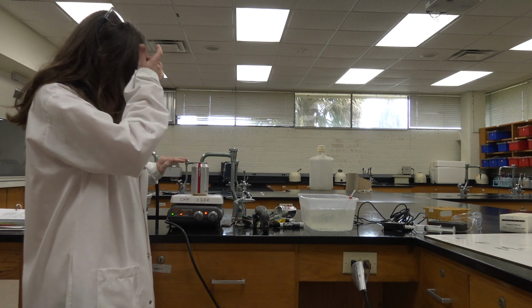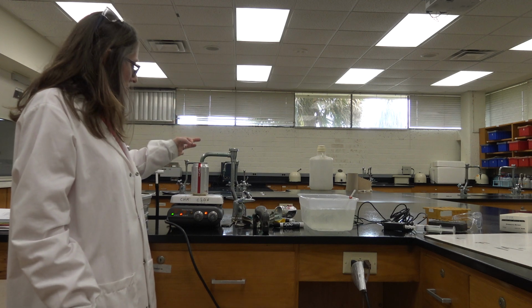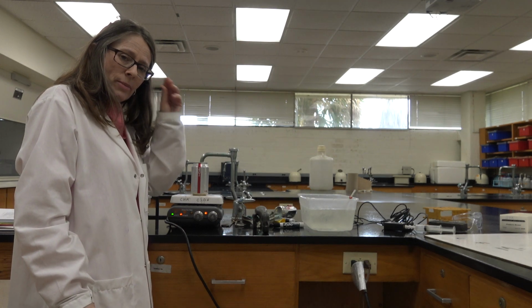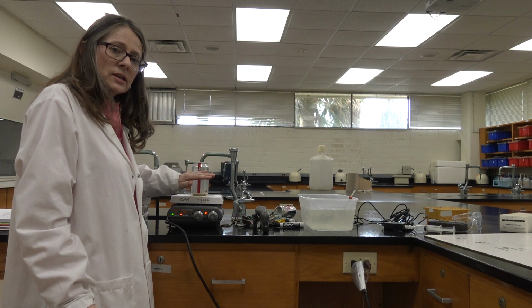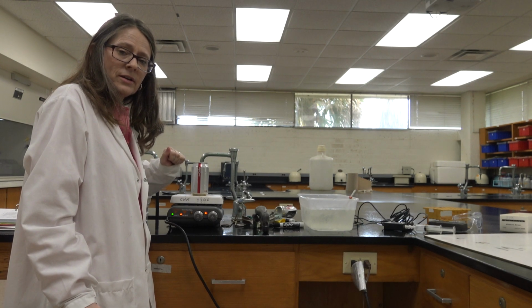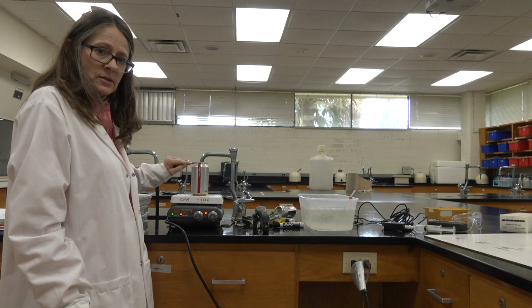Now, this gas has a certain temperature, and it's tempting to put the thermometer in there, but that's not going to work really well. I need you to go back and think of heating and cooling curves and phase changes. What's the temperature that a liquid turns into a gas if that liquid is water? You're going to estimate the temperature of that gas.